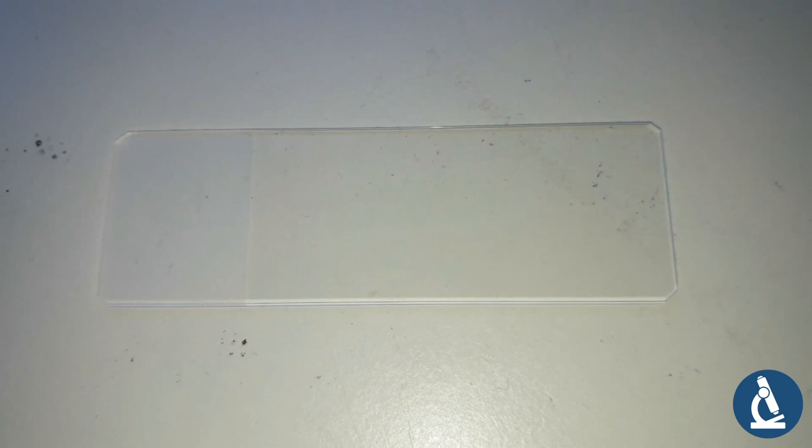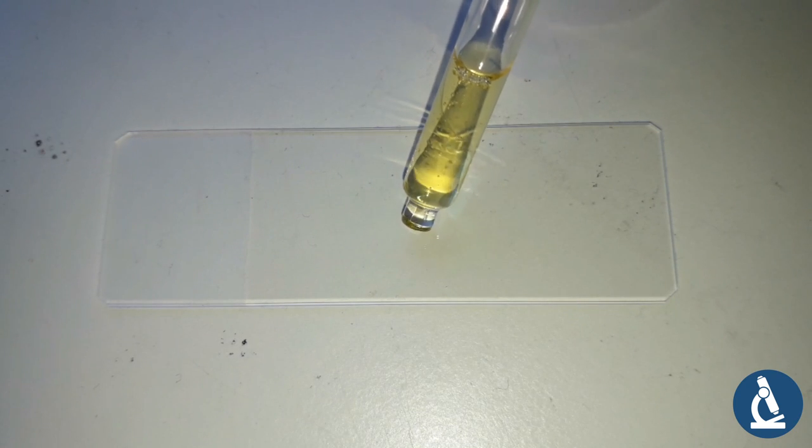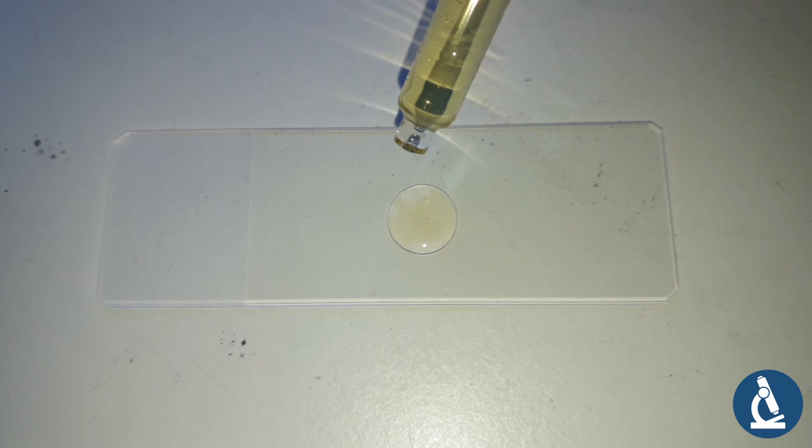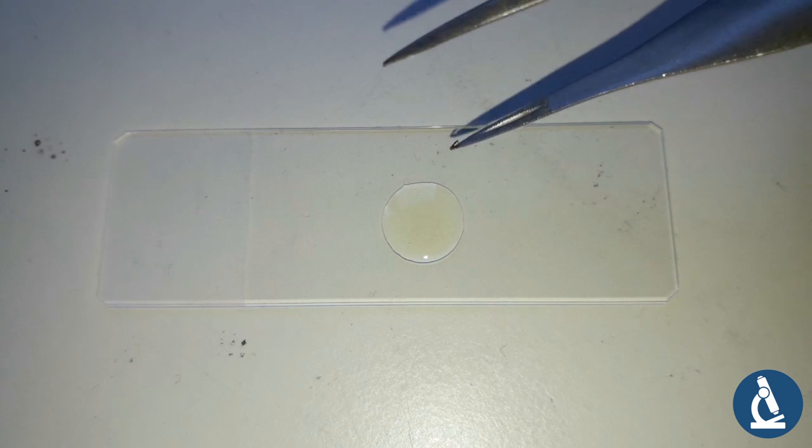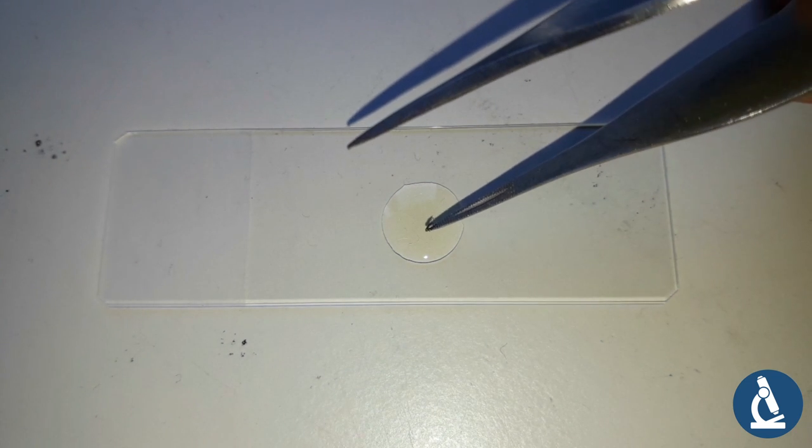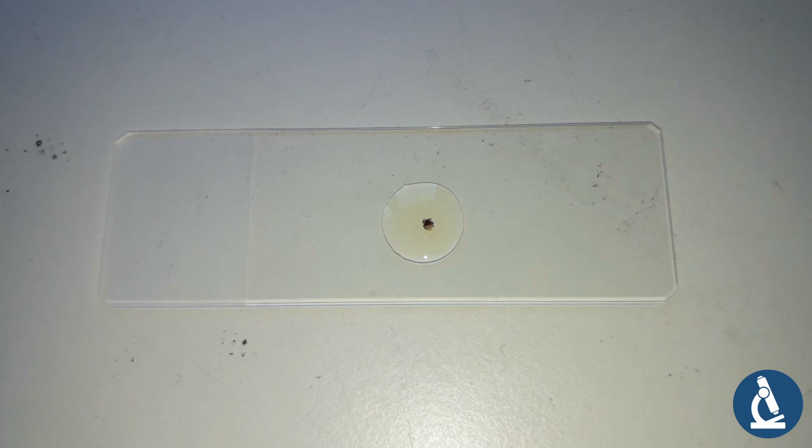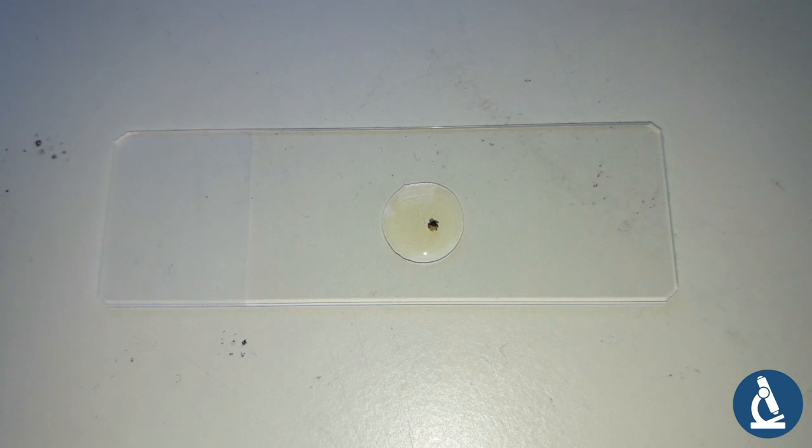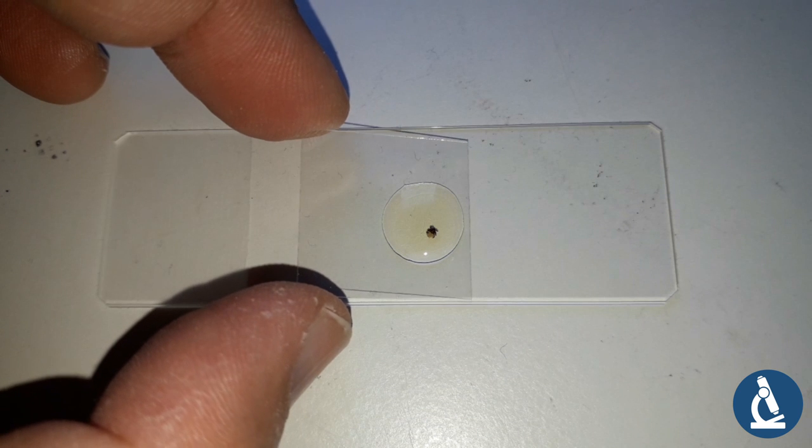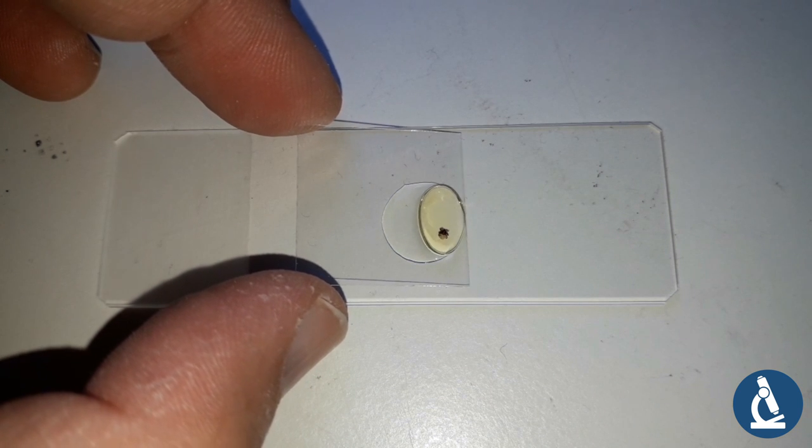It has eight legs. It is therefore related more to spiders than to insects. We extracted one just recently, and every time we pull out a tick from somebody's skin, I make a permanent mount using this tick. I'm currently placing it into Euparal mounting medium, which is my favorite mounting medium of use. In this mounting medium, the tick is preserved for a very long time.